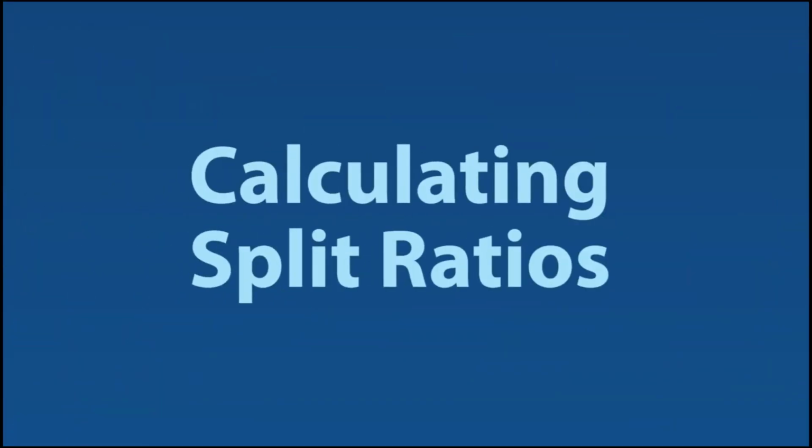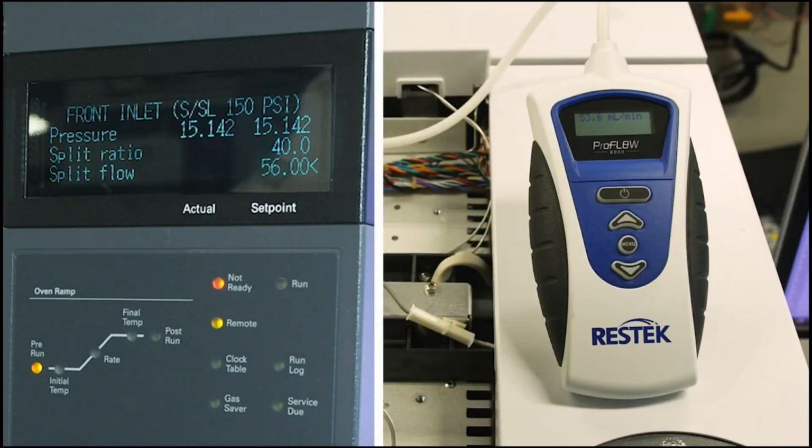Calculating split ratios. By measuring the split and column flows, a flow meter can help you calculate the split ratio. This can be useful when you want to verify that your ratio is correct and that the traps, restrictions, and valves are functioning normally. Verify results. Handheld, calibrated electronic flow meters can also be used to verify results obtained from onboard instrument software. Whether you're performing troubleshooting or routine maintenance, being able to double-check your results is a great ability to have in your hand.